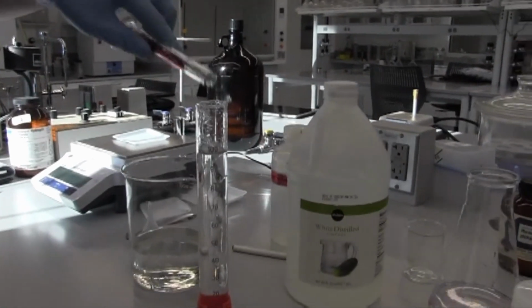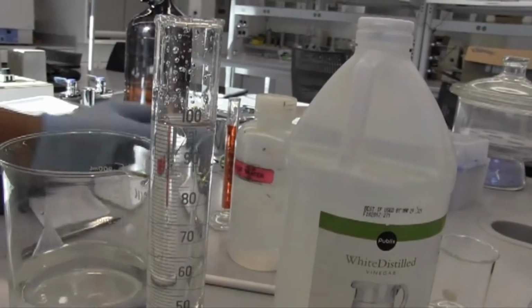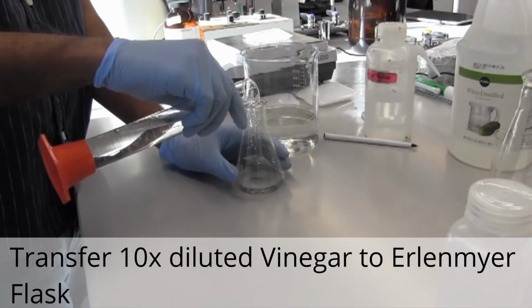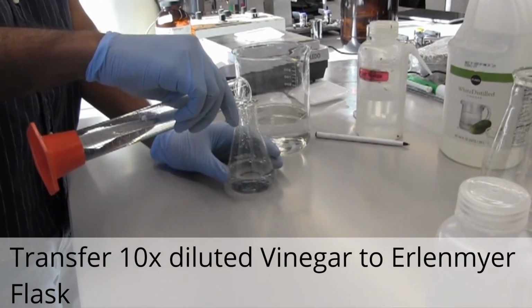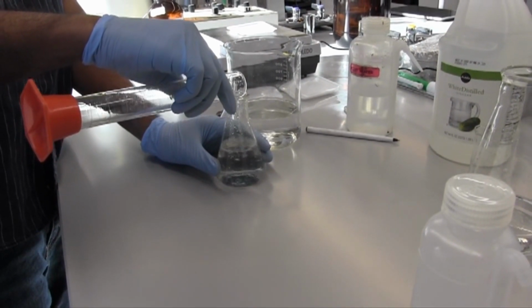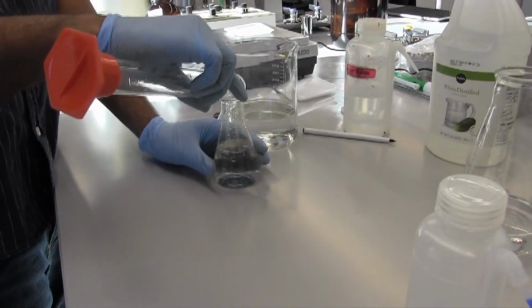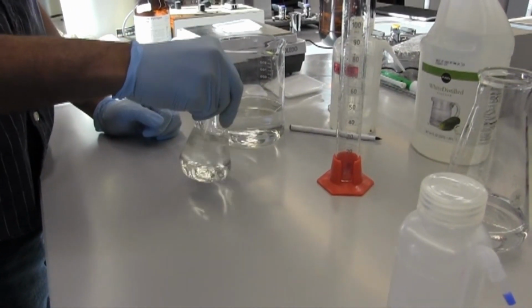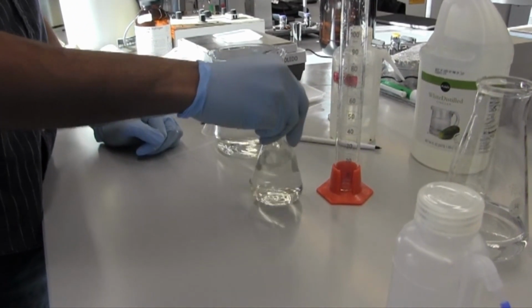So our vinegar is now 10 times diluted inside of this solution. Go ahead and pour that into an Erlenmeyer flask, and swirl it around to make sure that the vinegar is evenly mixed throughout the water. Perfect.